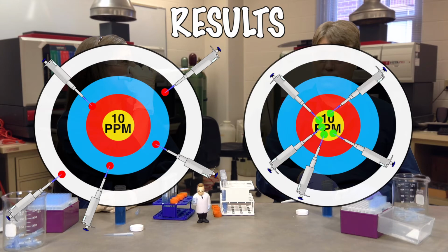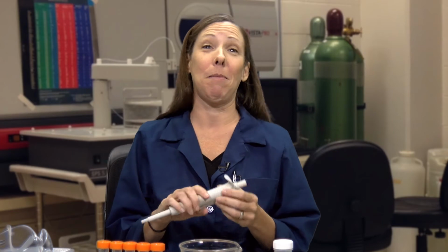I guess technique does matter after all.